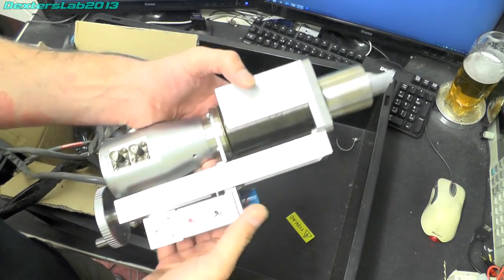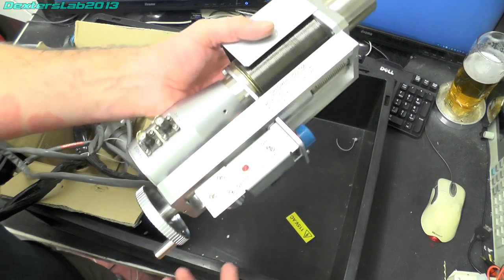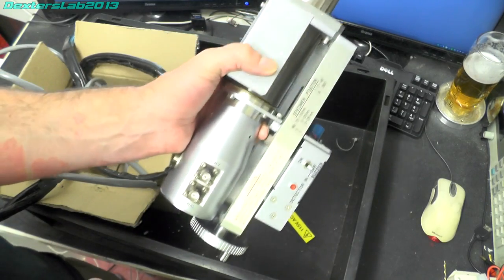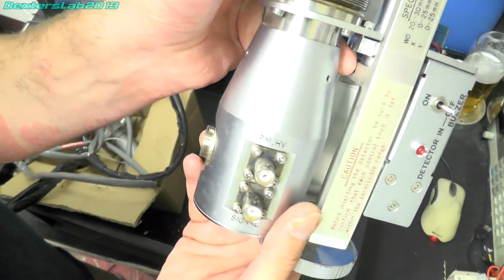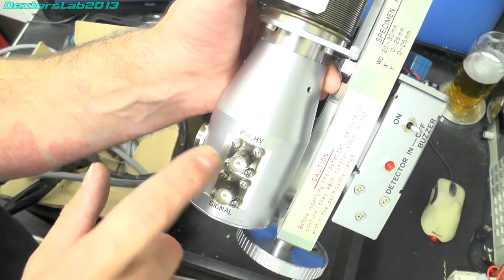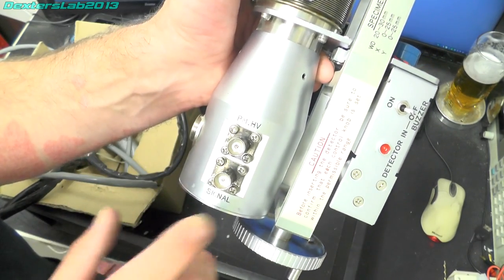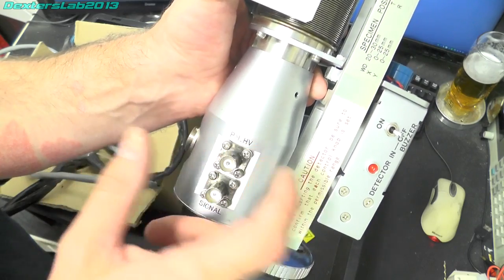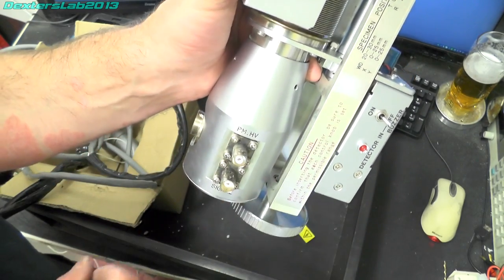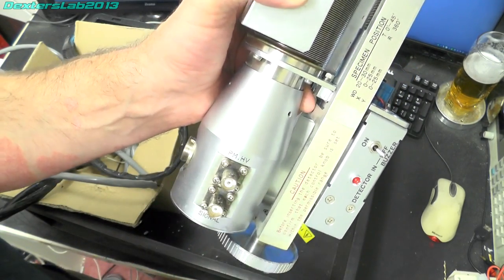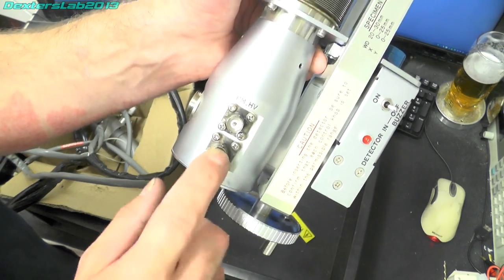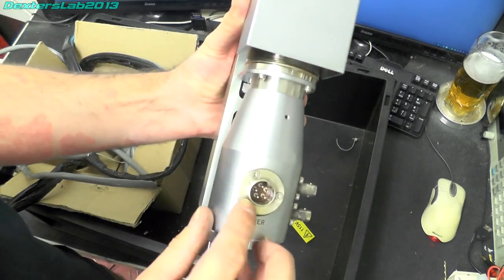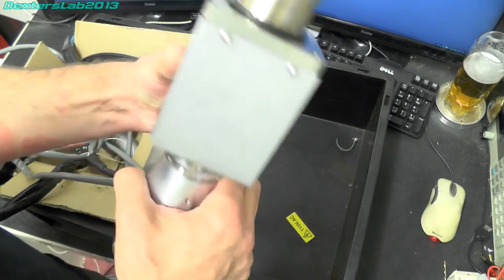And this is one of the detector modules. There's quite clearly a photomultiplier in here. These connections on the front here we've got PMHV and signal out so photomultiplier high voltage. So that would be the supply to actually run the photomultiplier tube and that would be the signal out, and we have a power input as well.